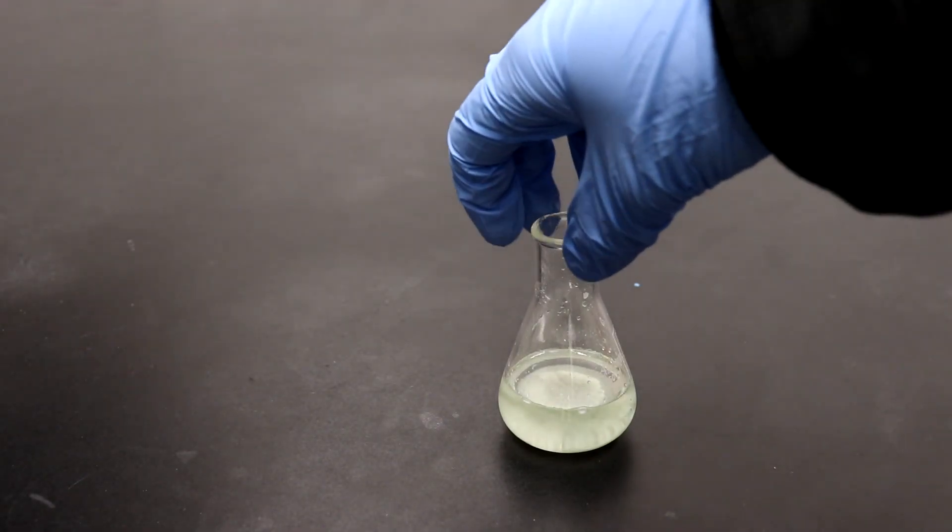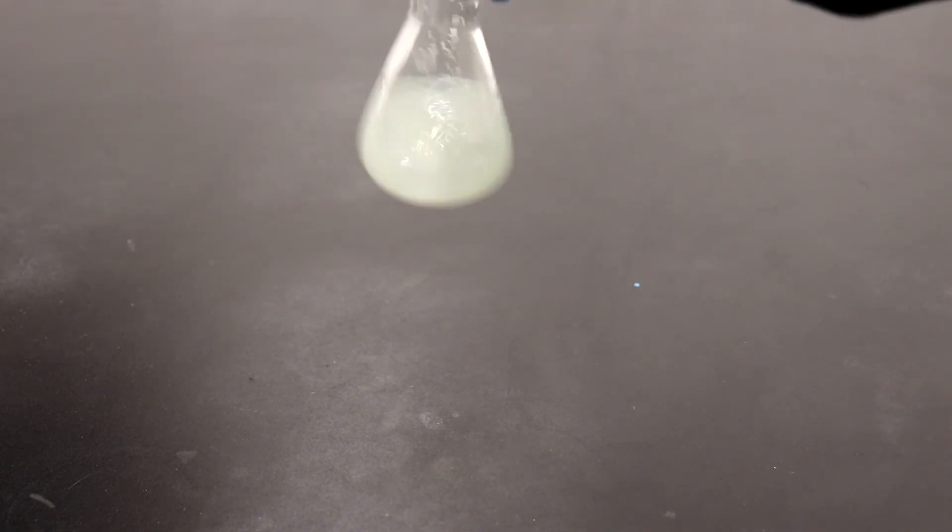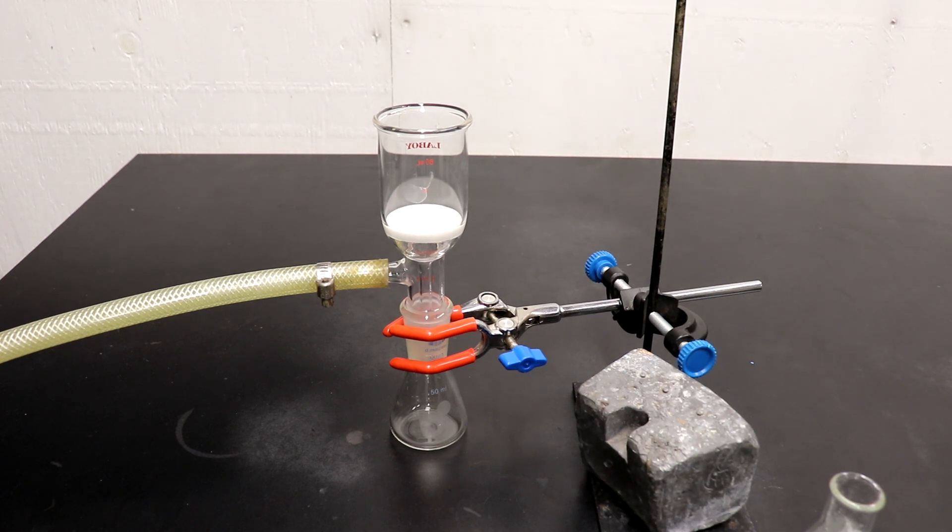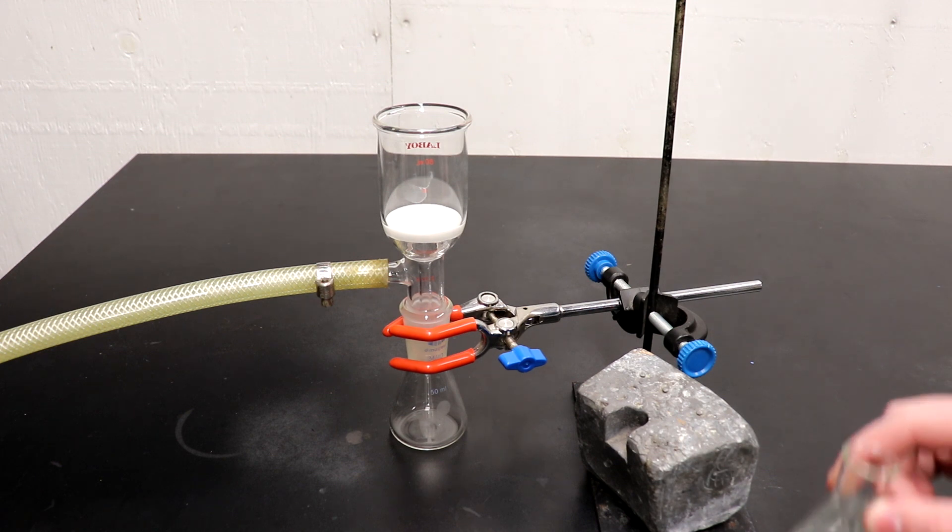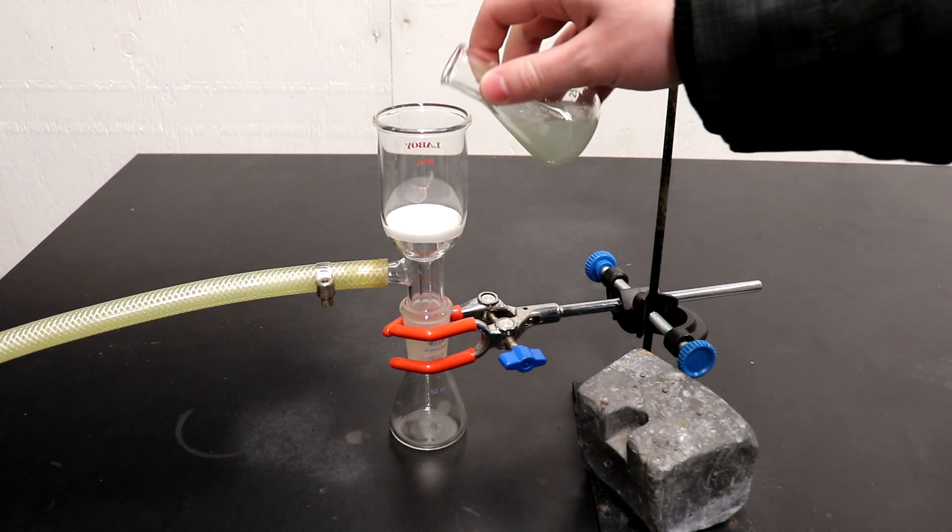Here is the wash product before distillation. Currently, I have it sitting over magnesium sulfate to dry it. The 1,4-dibromobutane has been sitting over anhydrous magnesium sulfate for just about two hours now, so now I'm going to do a vacuum filtration on it to separate it from all the magnesium sulfate.